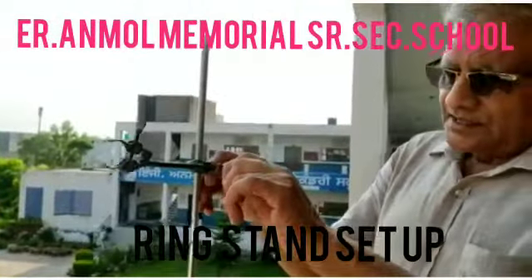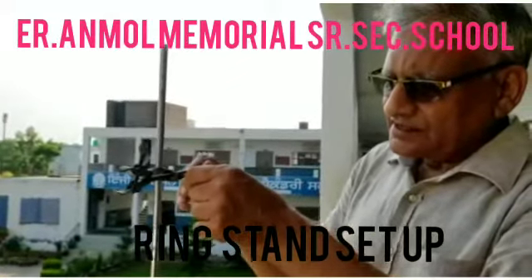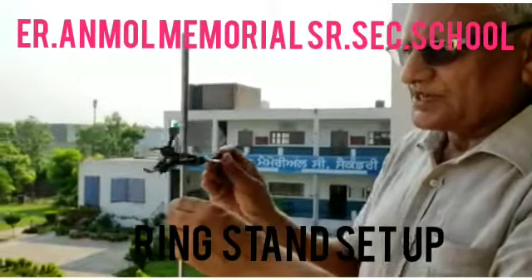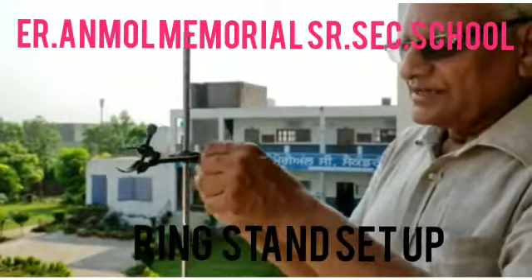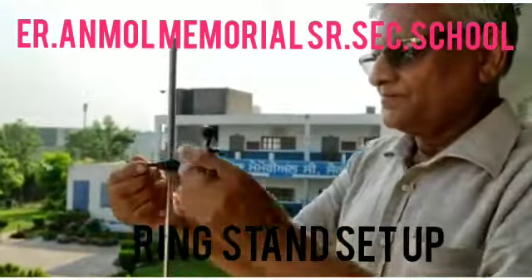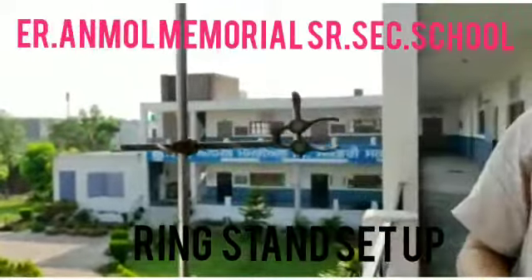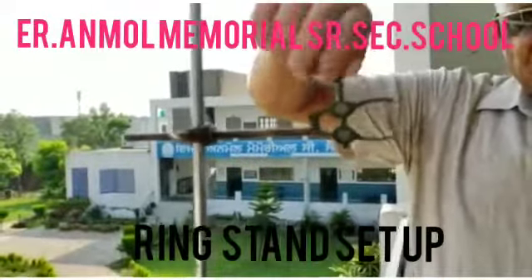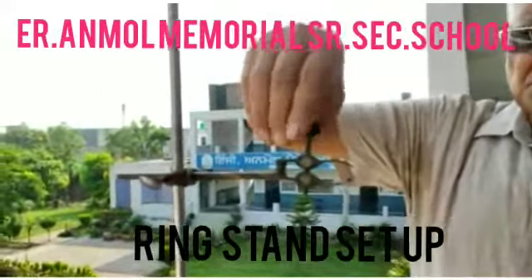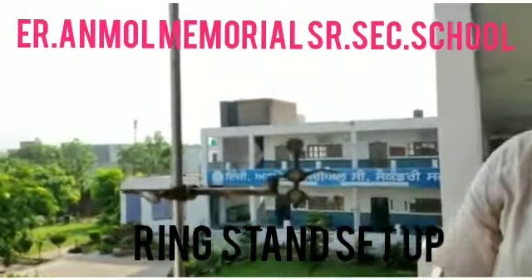Again I am telling you that it can be adjusted. Moreover, it can be made broader, nearer, and farther — it can be brought nearer and farther by adjusting this screw. You can also revolve it by adjusting the previous screw. By turning it clockwise the space will be reduced, and when you turn it anti-clockwise the space is more.